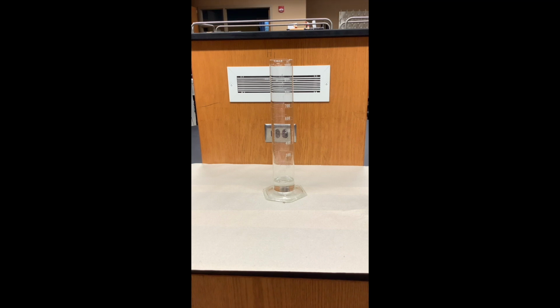The hydrogen peroxide will decompose on its own to form water and the gas oxygen. So it's just happening so slowly that we don't see any bubbles. So I'm going to capture the bubbles that I form in this soap solution. It's still not happening very fast, so what we're going to do is speed up the reaction using a catalyst.